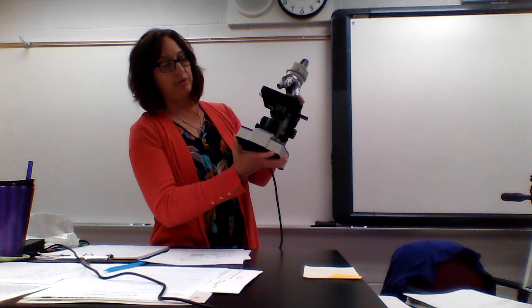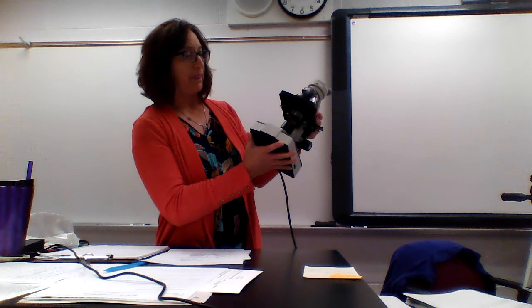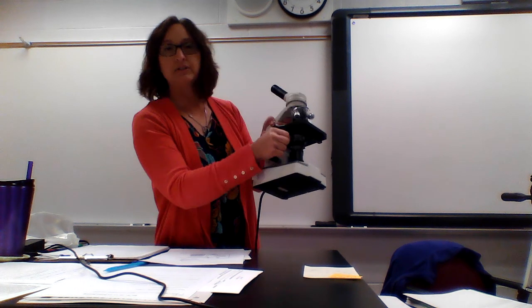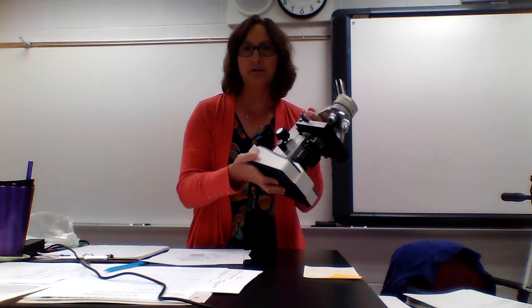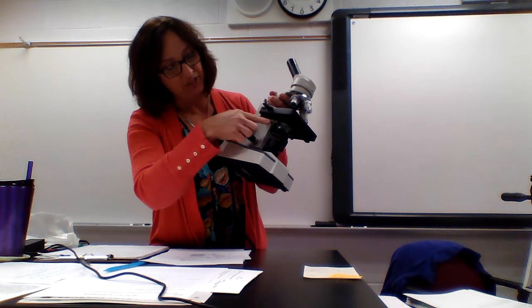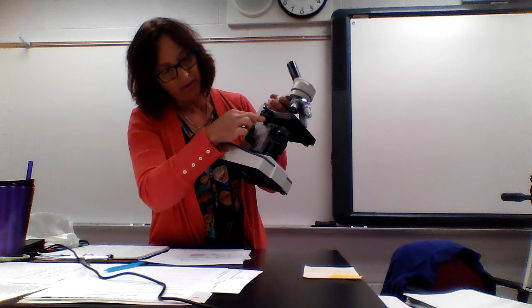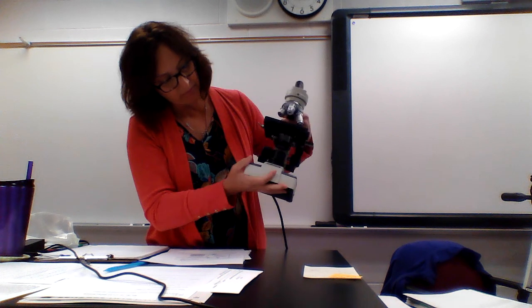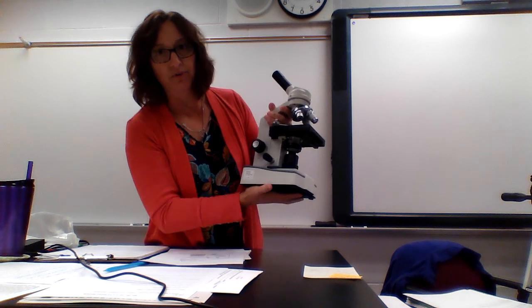You actually have an iris diaphragm on here. Your iris diaphragm, let me see, I'm not sure how I can get the angle right here. The silver knob, I don't know if you can see that.